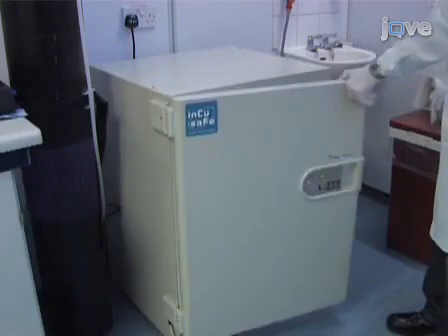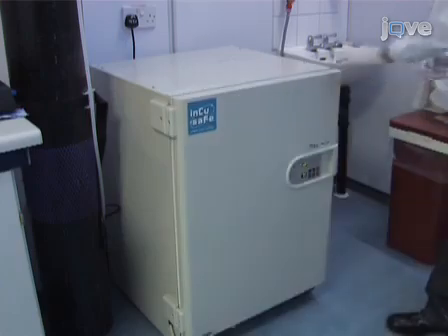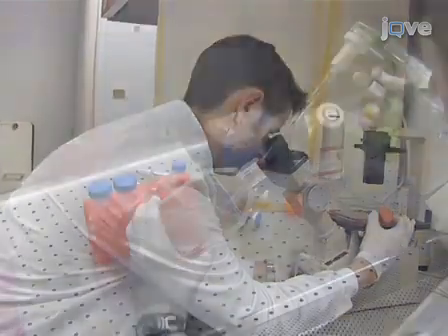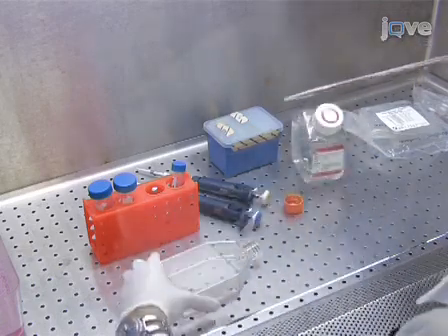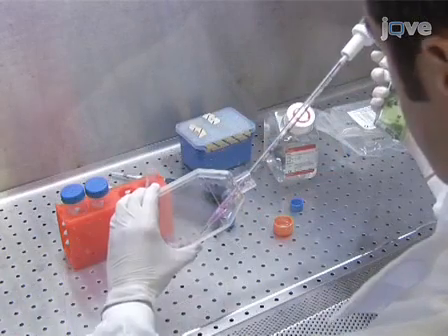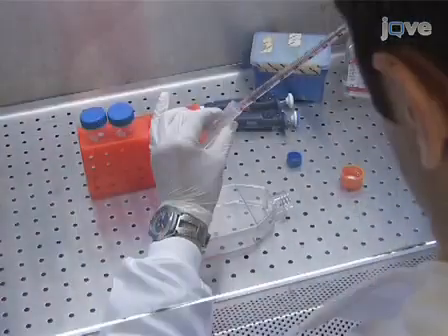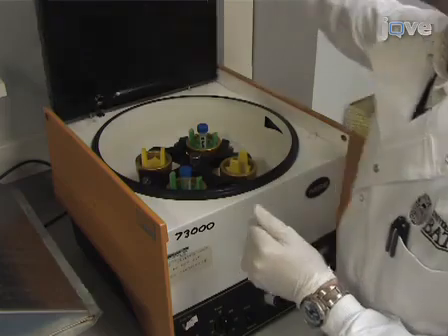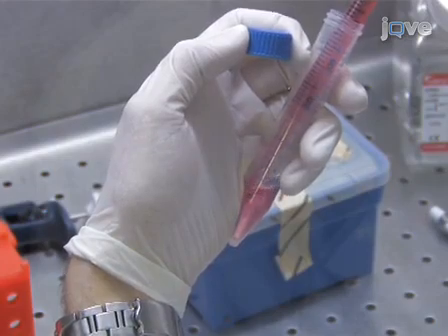For this assay, we use human endothelial EAHY926 cells cultured in T75 flasks at 37 degrees Celsius. Harvest the cells once they have reached about 95% confluency. Wash the cells with 10 ml of PBS to remove the growth media. Detach the cells by incubating in trypsin EDTA solution for 5 minutes, then transfer to a conical tube. Next, centrifuge the cells and resuspend them in about 25 ml of complete DMEM medium, or at a concentration of 1 million cells per milliliter.